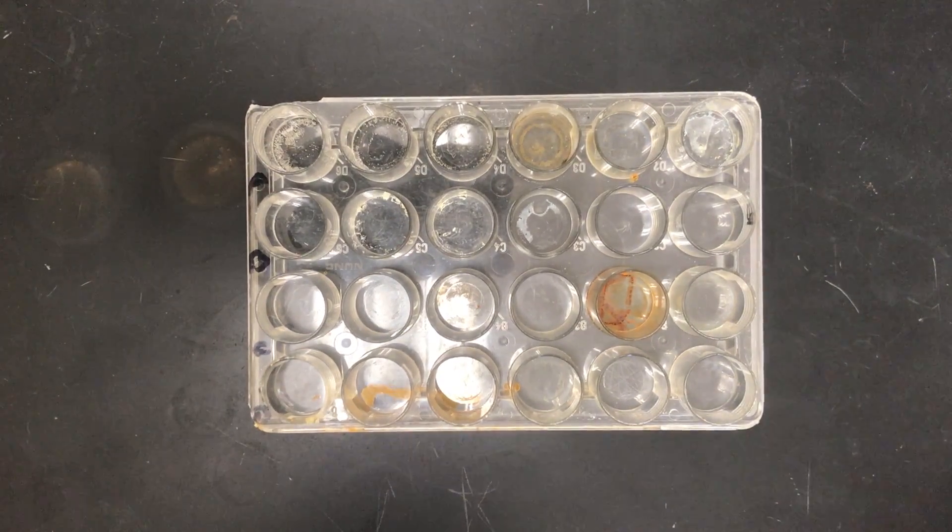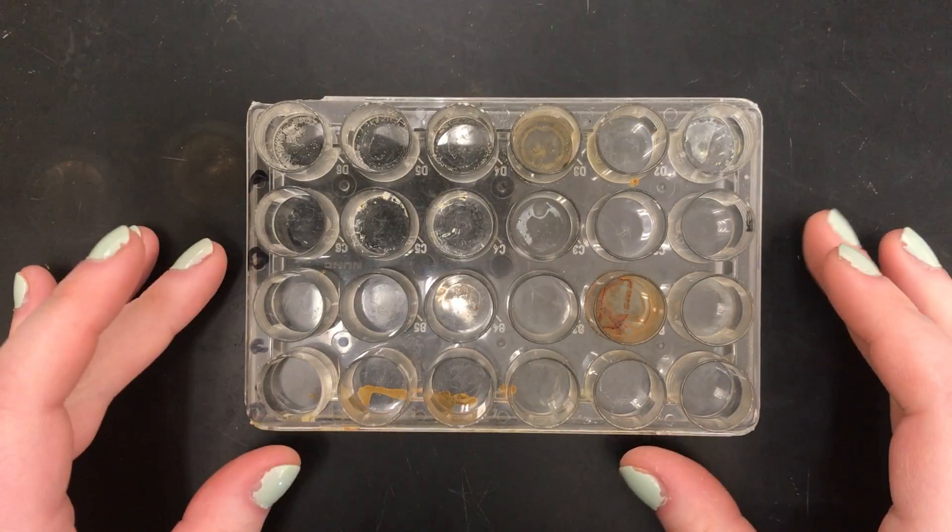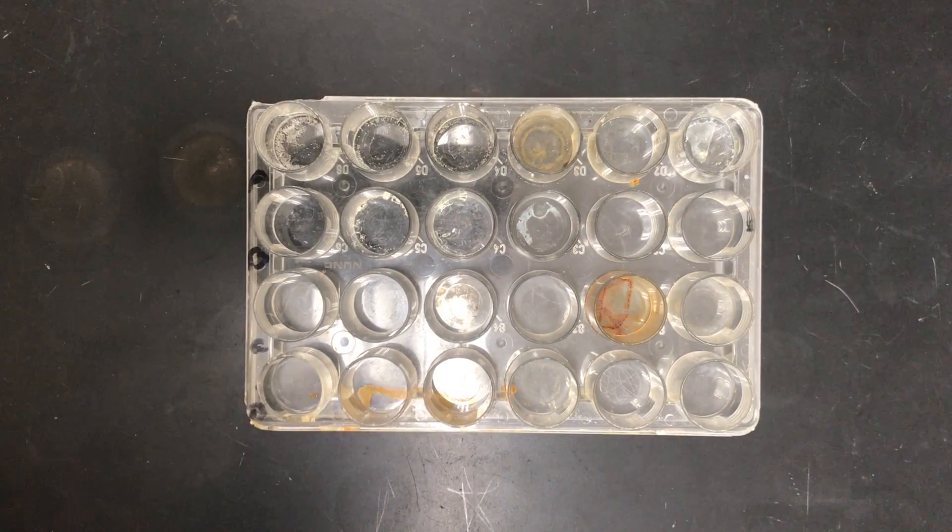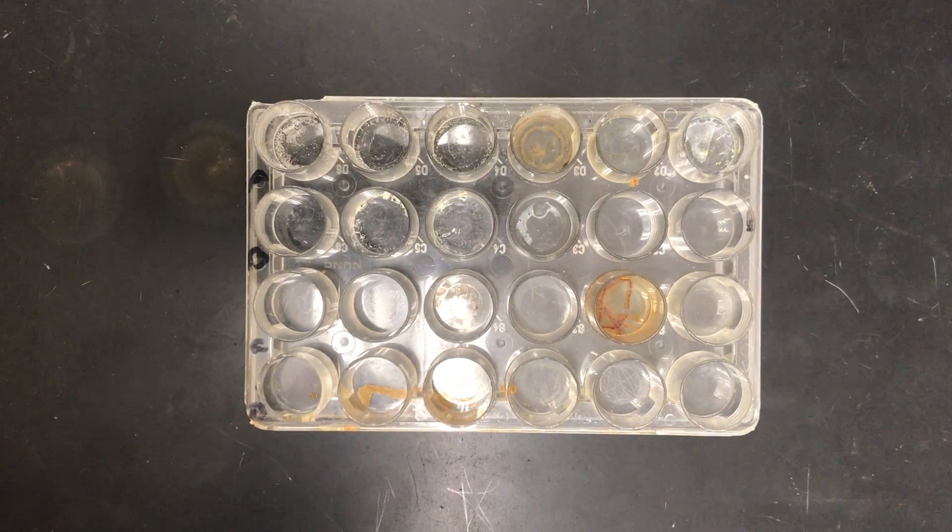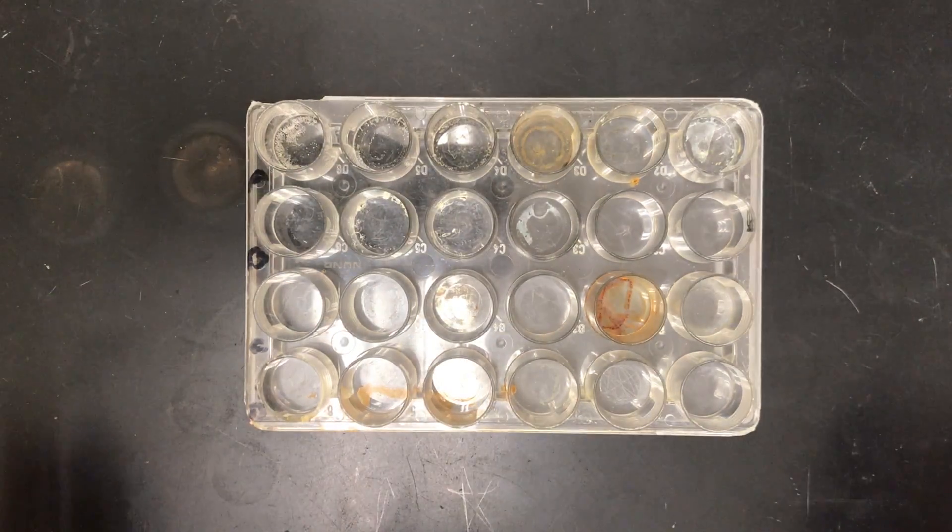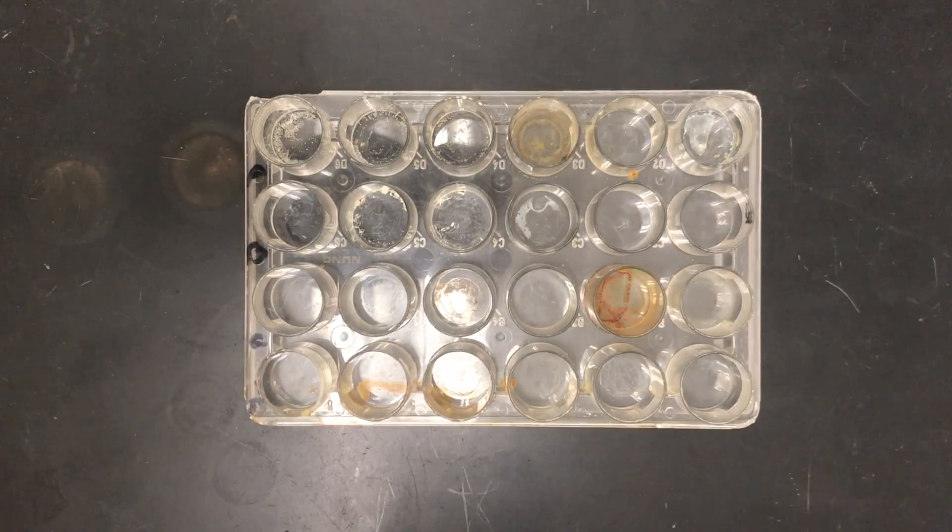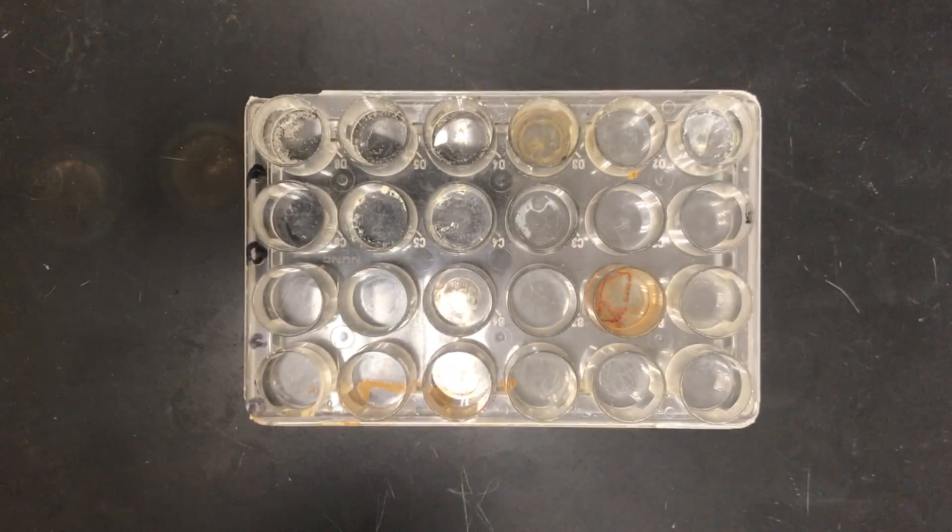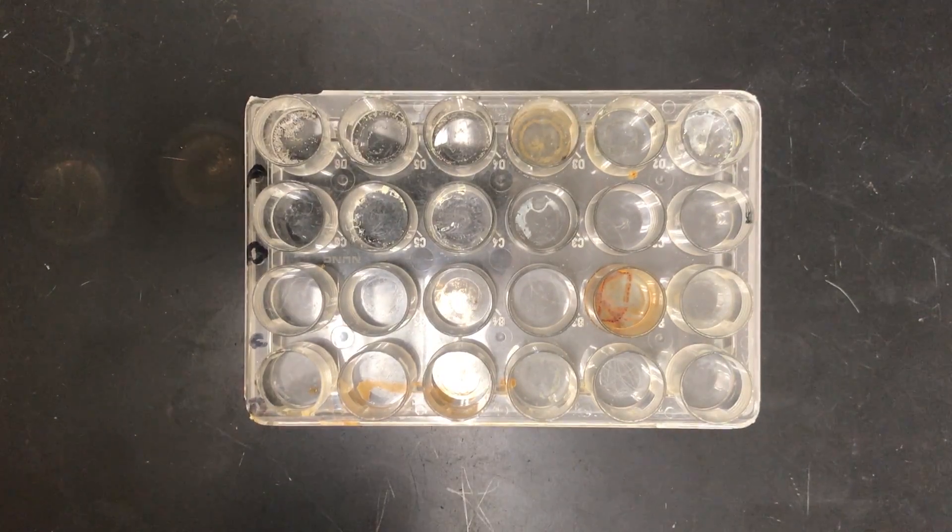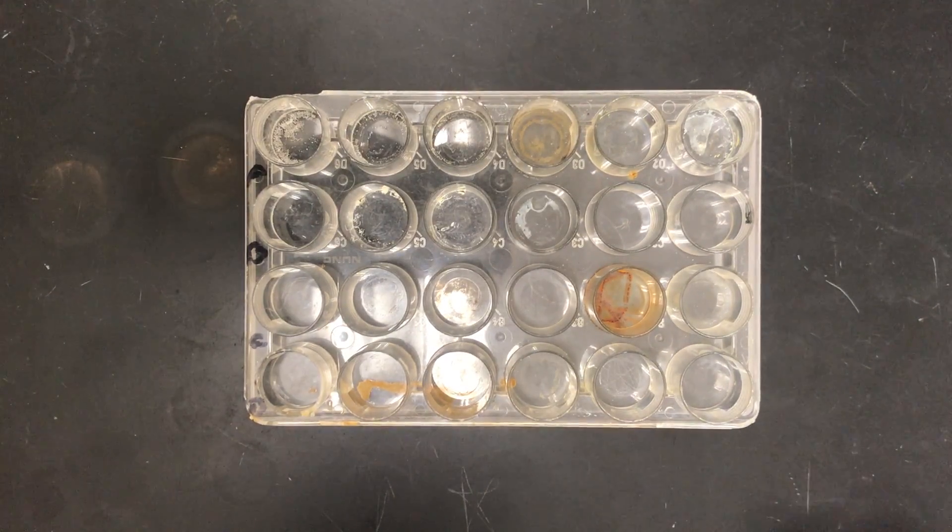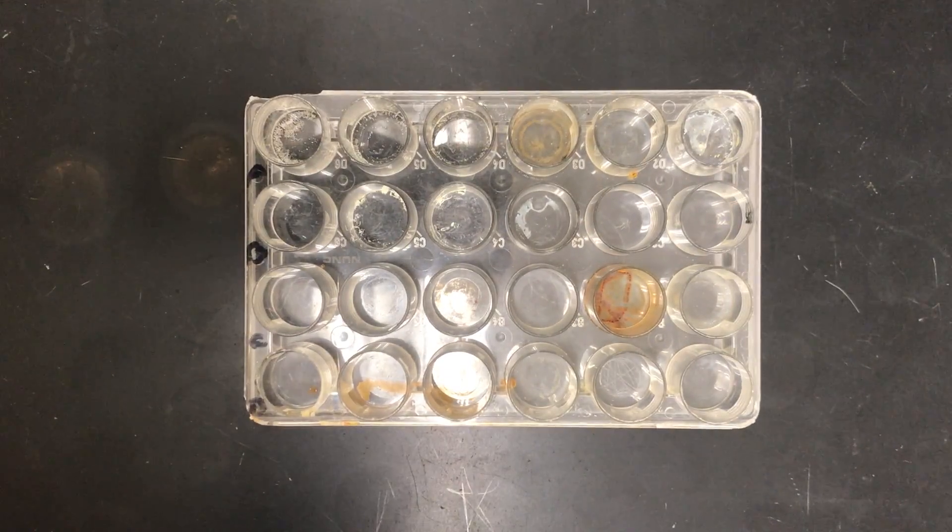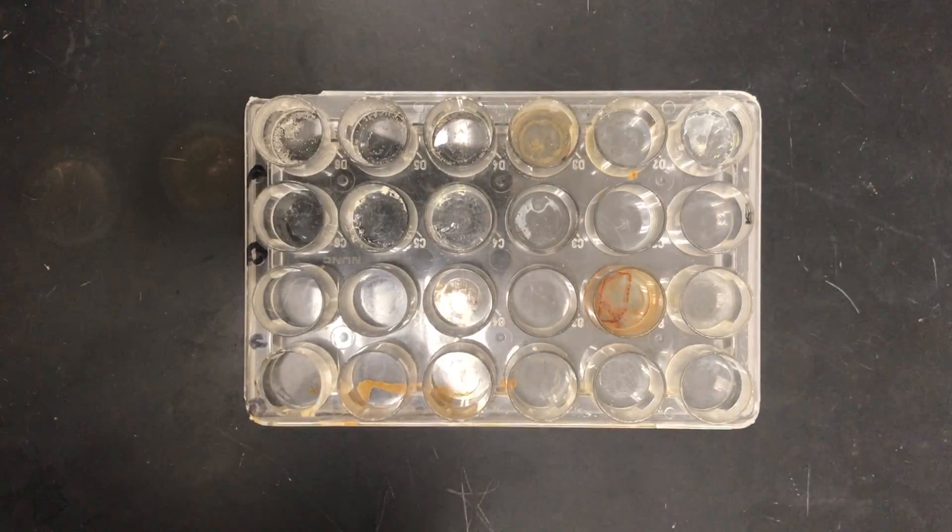All right guys, so this is a demonstration for our murder mystery lab of the experiment in part one where you wrote out the four equations and then balanced them and predicted your products. And then we had to perform the experiment in order to confirm our product predictions. The order that you have them on your paper might not be the order that I do these reactions, so listen carefully and make sure that you have the reactions correct for which ones that I am demoing here.